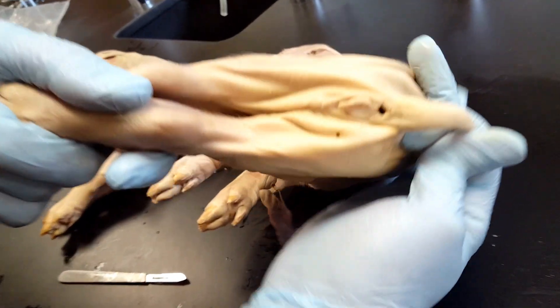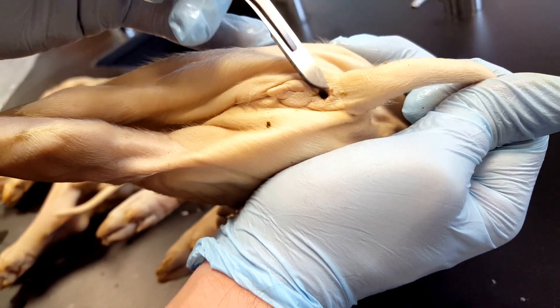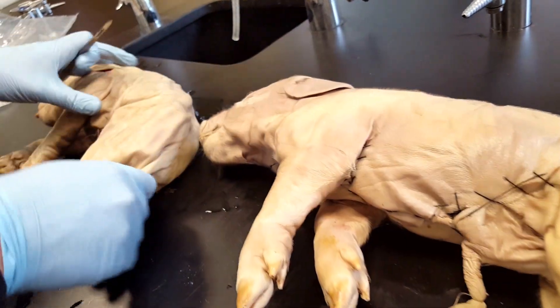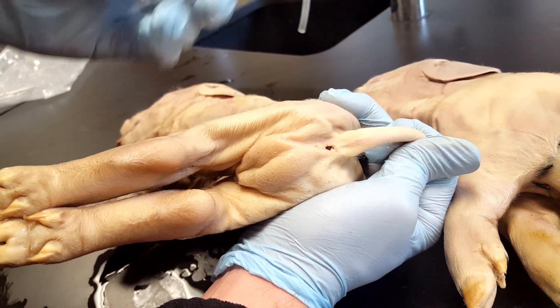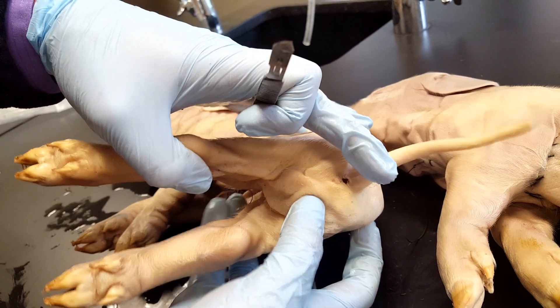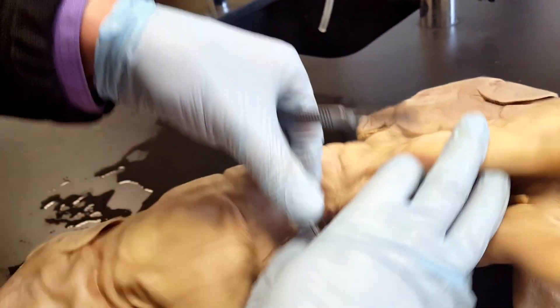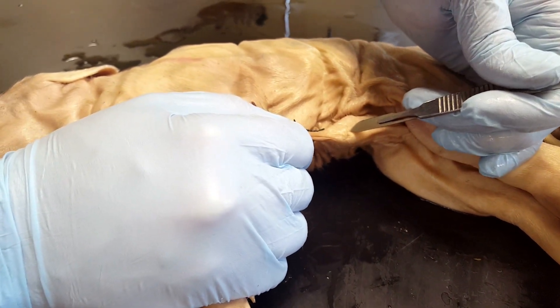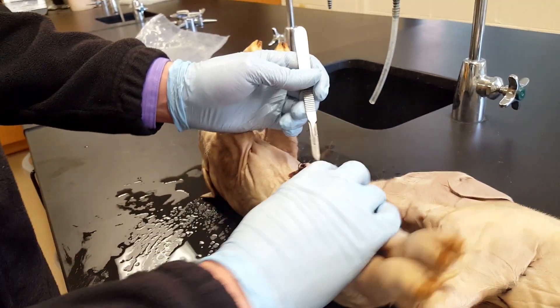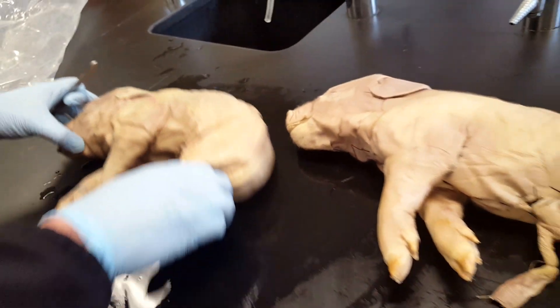One way is to look on the back. If you have two openings in the back, then you have a female. If you look at the male, there's only going to be one opening in the back. You might also be able to make out the testes sticking out there. The male's urethra is going to exit by the umbilical cord, but that might be harder to see. Don't try to judge whether it's male or female by nipples on the belly, because they both have them in fetal pigs.